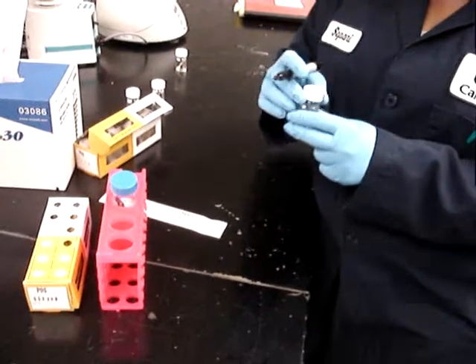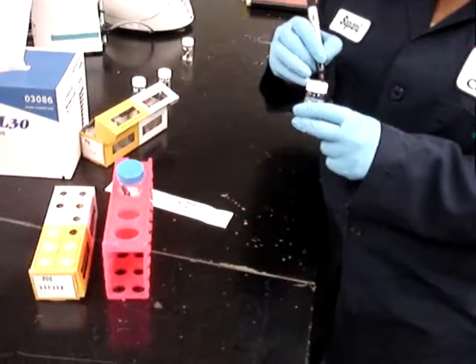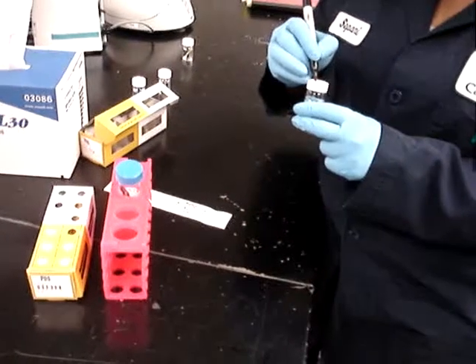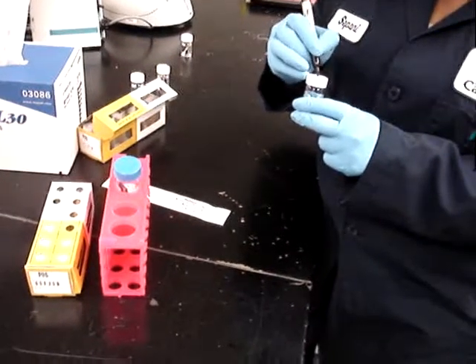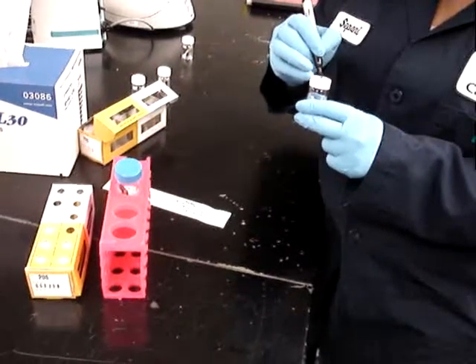What we'd like to demonstrate is the convenience of obtaining a sample to monitor microbial corrosion using genetic techniques.